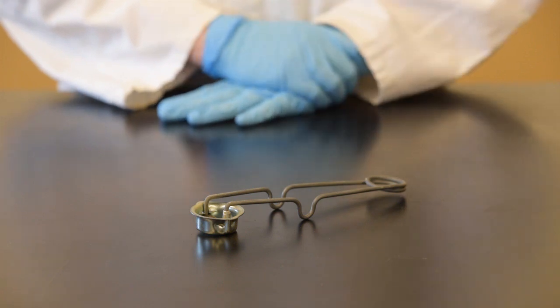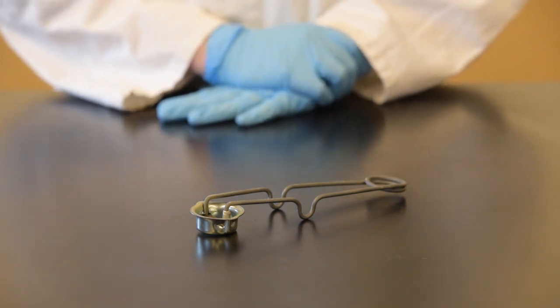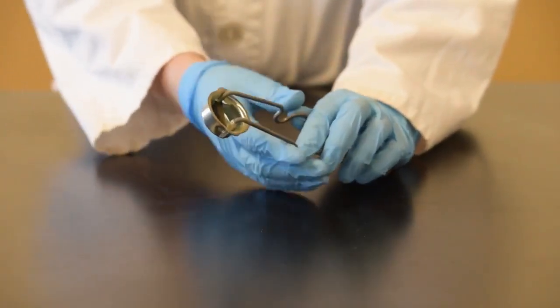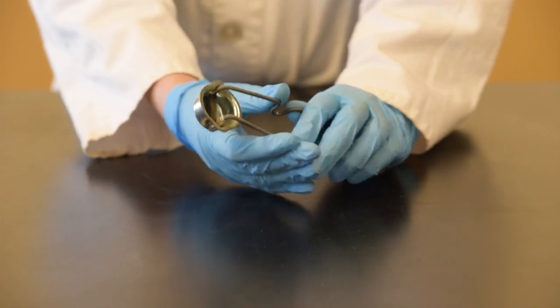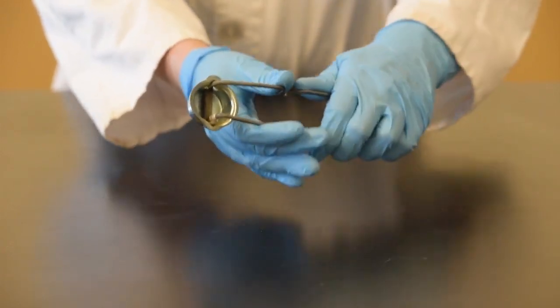This is a Bunsen burner lighter. Its job is to make a spark which will ignite the flow of propane from the Bunsen burner. To make a spark, squeeze the lighter. There has to be a lot of friction between the flint and the steel ribbon, so make sure you are also pushing them together. Pushing down and squeezing may be a little awkward at first, so practice making a spark with the lighter before the fuel is flowing.